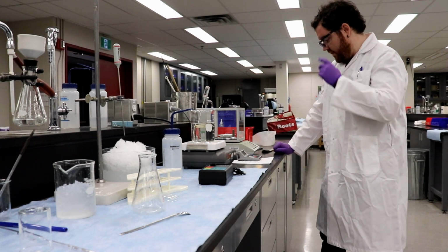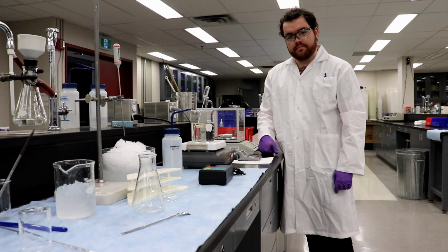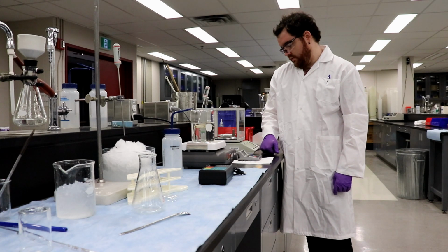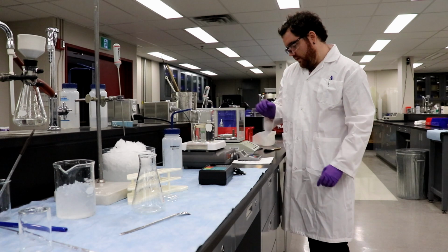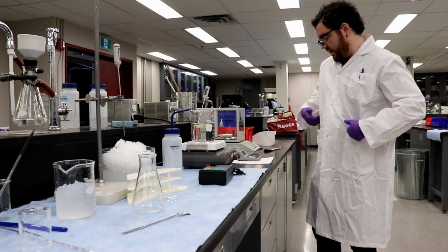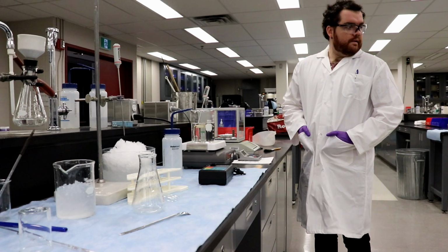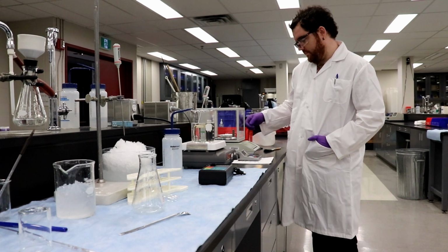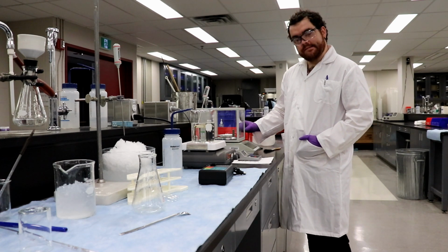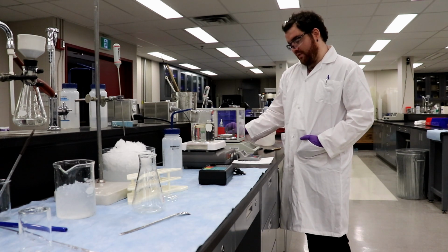So our total mass right here is 59.4475 grams. It's changing now. Hold on. Okay. Are the doors closed? Yeah, now there. Take my hand off. 59.4450. 59.4450 grams, correct. Yep. And the big watch glass was pre-weighed to 49.8567 grams. So about 10 grams total.